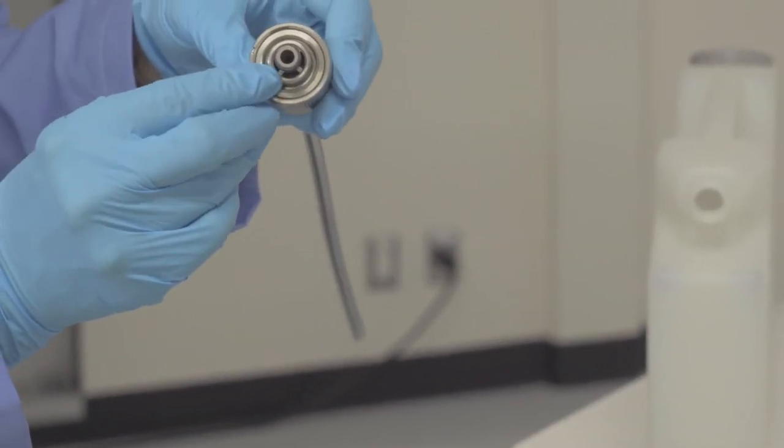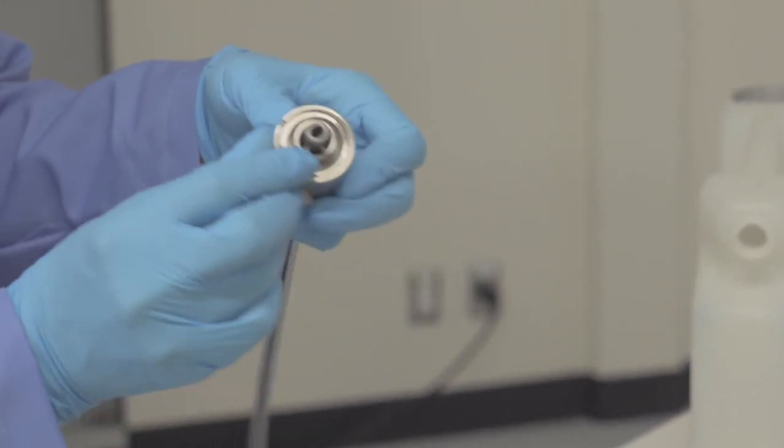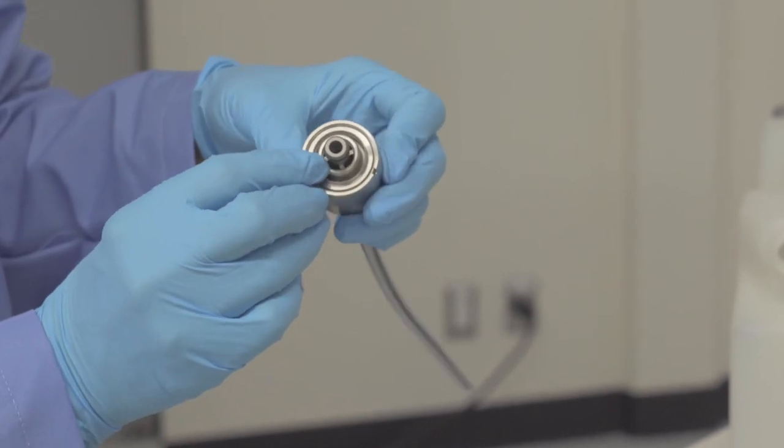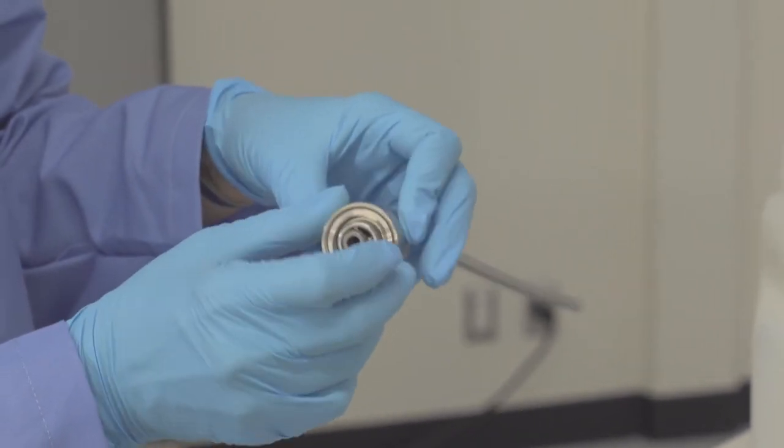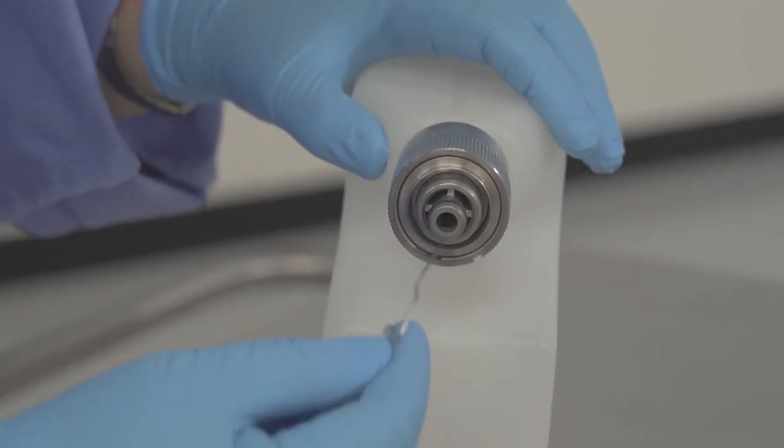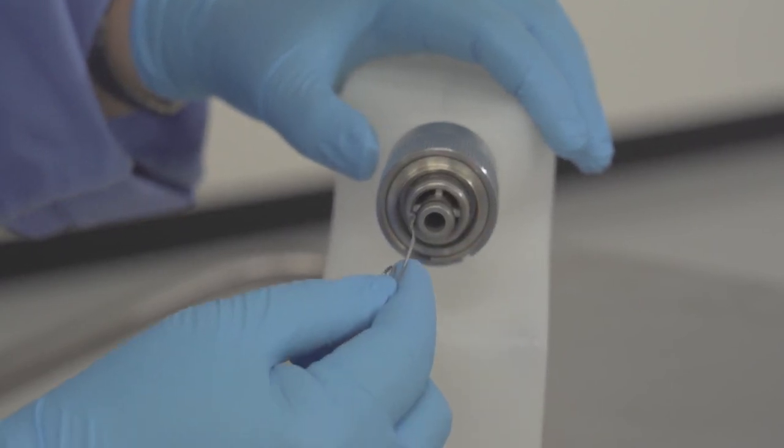If you were to remove the nozzle from the container, you will notice that around the nozzle tip you have some air holes or slots. It is important that these slots or holes be kept clean and that you perform a visual inspection when reagents are changed. If you do notice any buildup in these holes and slots, you can easily clean by straightening out a paper clip and using one end to remove any buildup that you find.